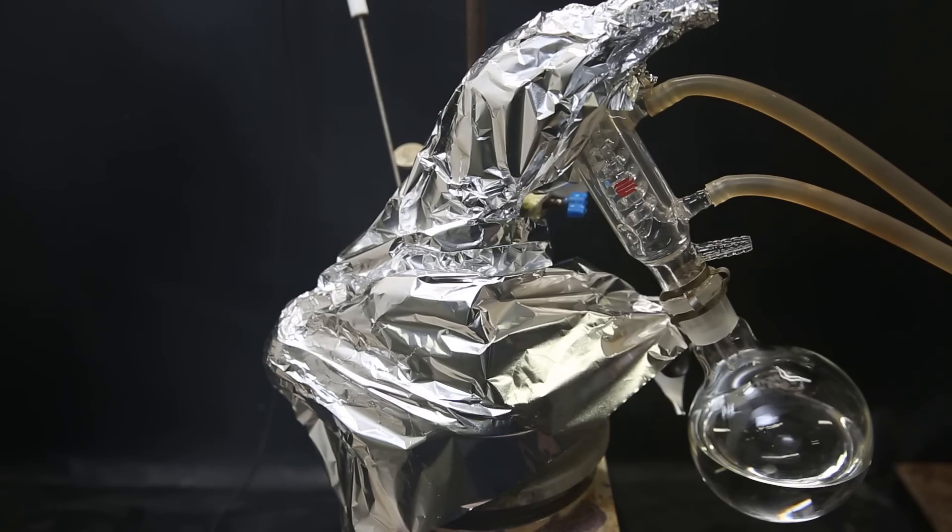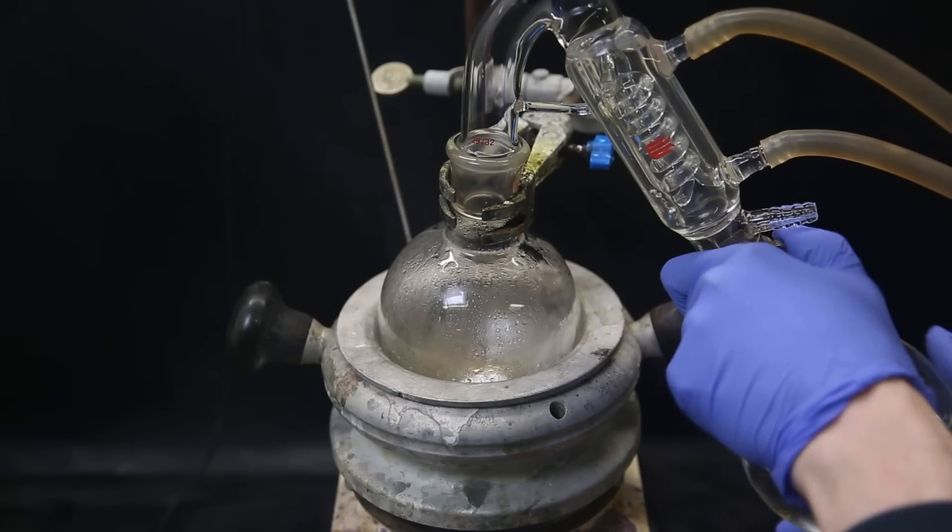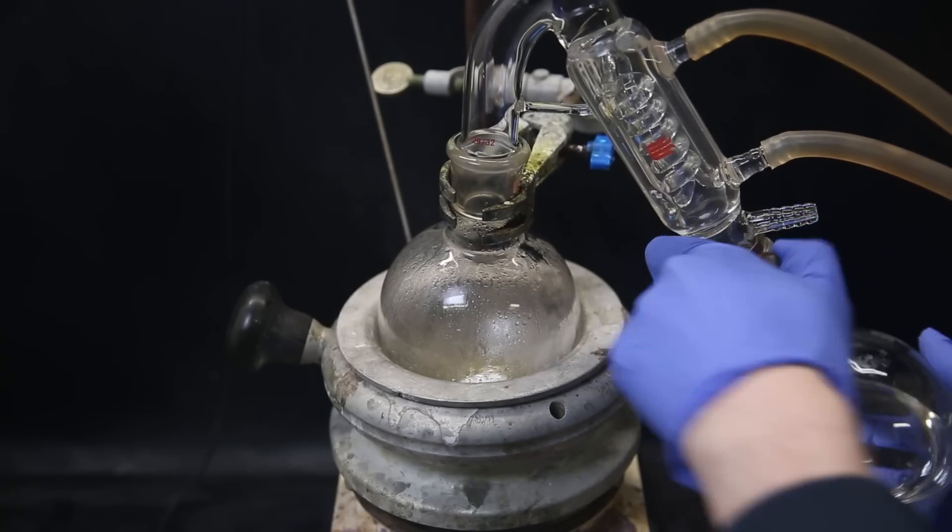When it pretty much stops coming over, some liquid that doesn't distill at this temperature is left behind, which might be impurities from the reaction or some ethylene glycol that I distilled over.